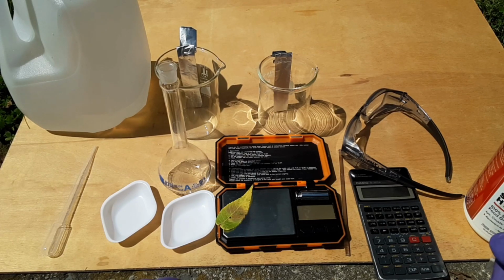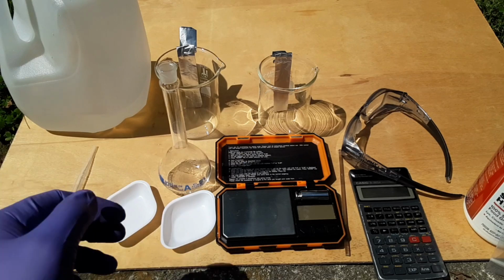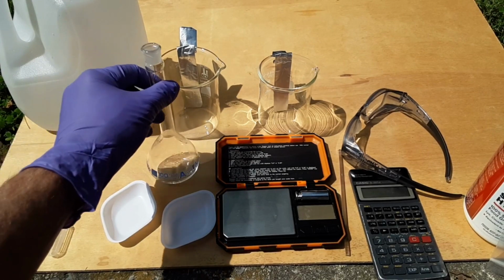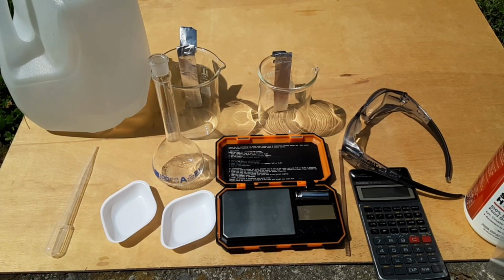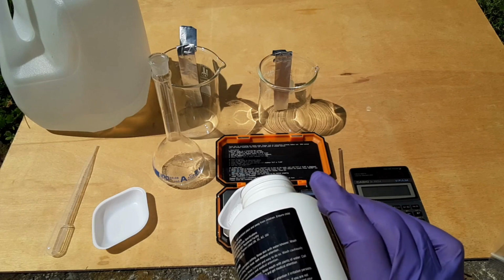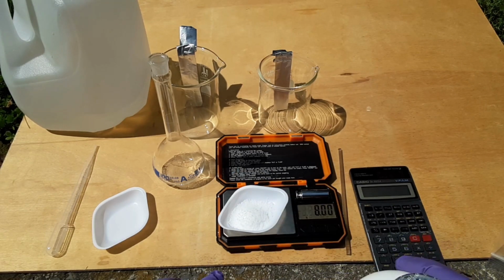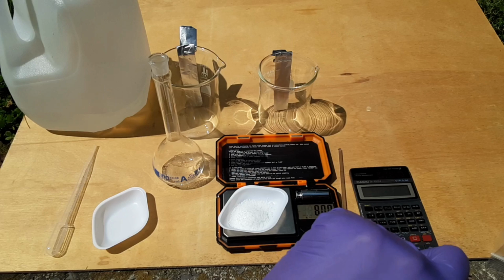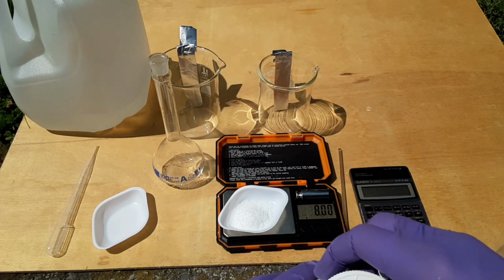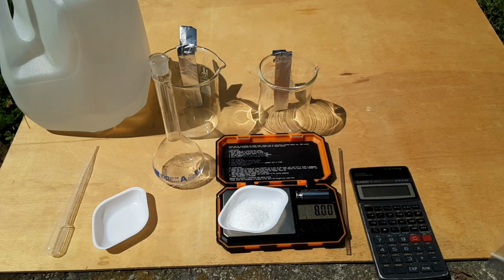So, I don't know. I'm just going to make a 2 molar solution here. The molar mass of sodium hydroxide is so close to 40, we're just going to use 40. So in 100 milliliters in a volumetric flask, we're going to need 8 grams of sodium hydroxide to make a 2 molar solution. Well, I'm not sure how I did that. I couldn't even see the end of the bottle when I was doing that. Maybe that's the best way to do it. If you can't see how much is coming out, it actually comes out right.